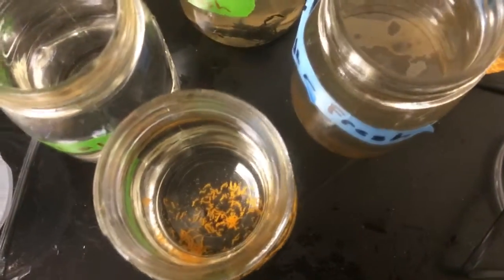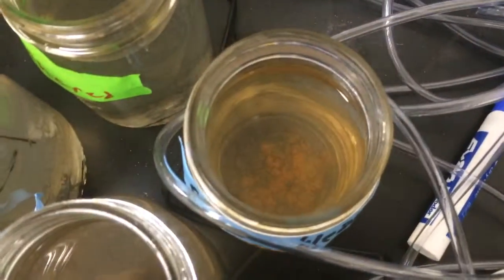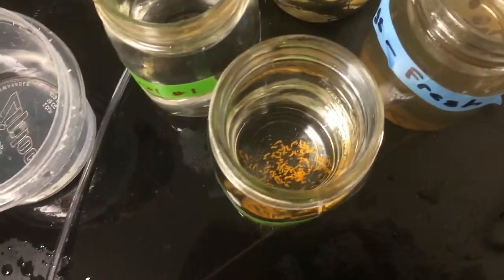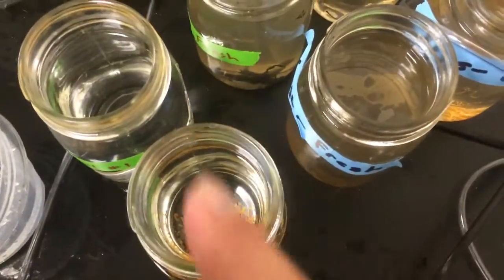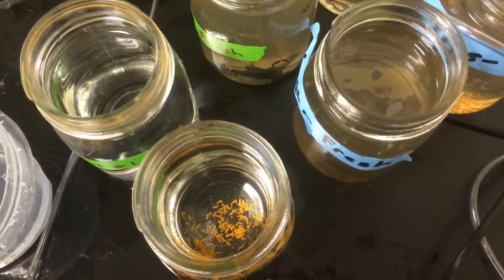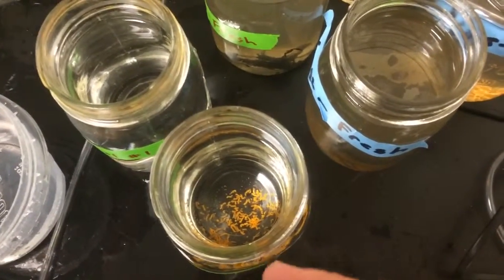So they're bright orange and we're roughly dividing the eggs from an individual into each replicate. So here's part of her eggs in the control, just pure seawater.